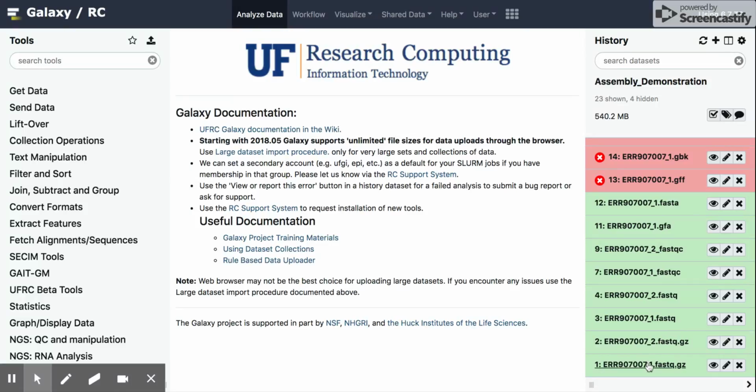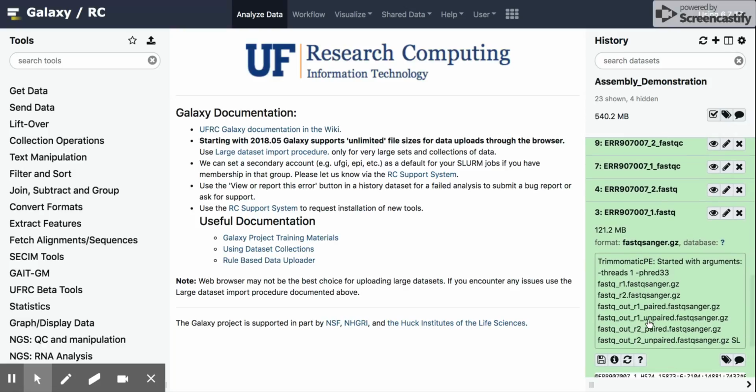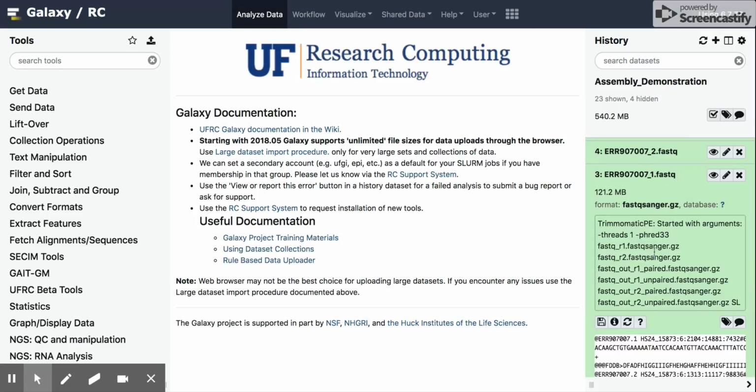If you recall, 1 and 2 are the input data sets, 3 and 4 are from Trimmomatic. And if we click on this link, we can see a couple of different things here. It'll populate this little window below it, and you'll see a number of different pieces of information. One is the size of the file, 121 megabytes. Information about the commands that were run.